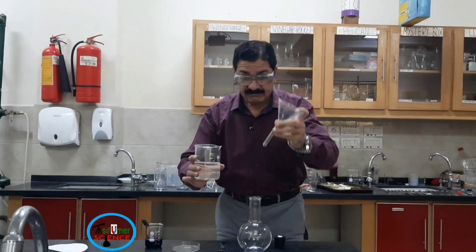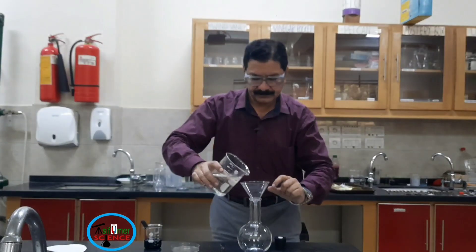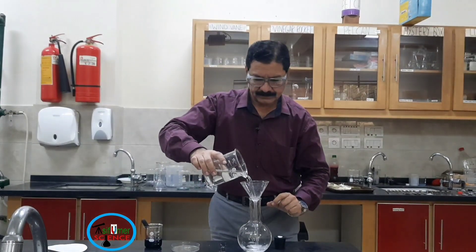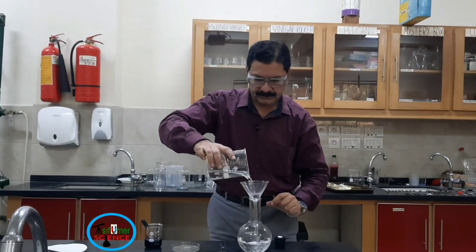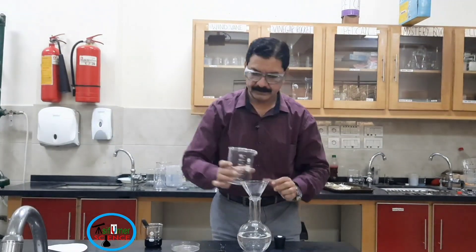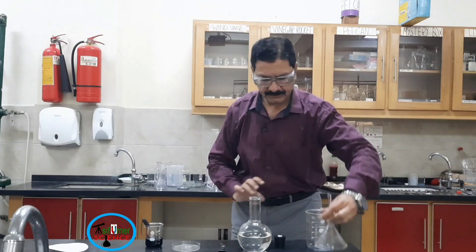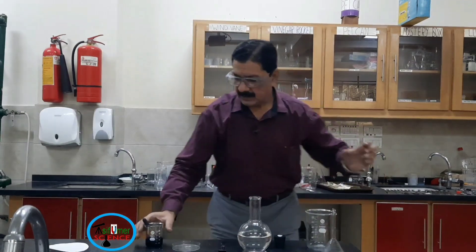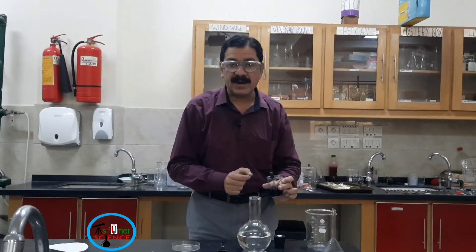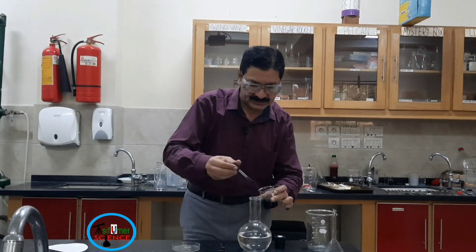Now I am going to pour all the solution into the flat bottom flask with the help of a glass funnel. Then I will put a few drops of indigo carmine indicator into the same solution.